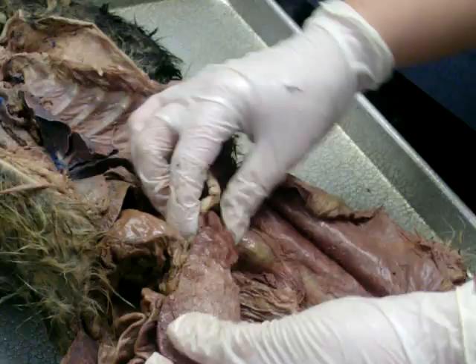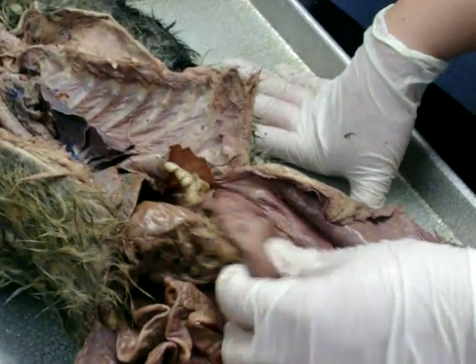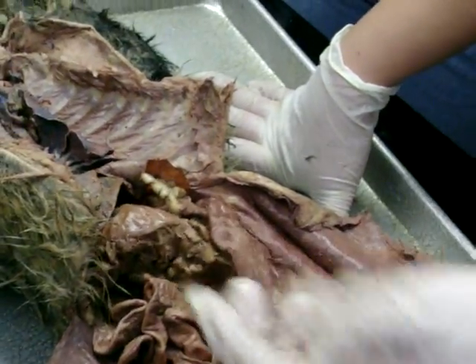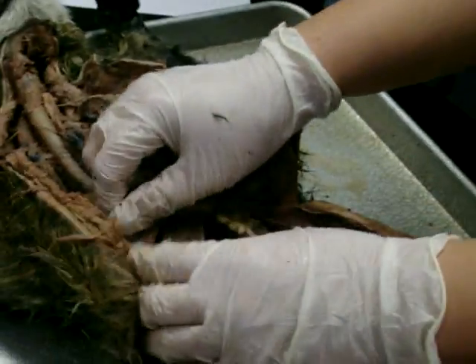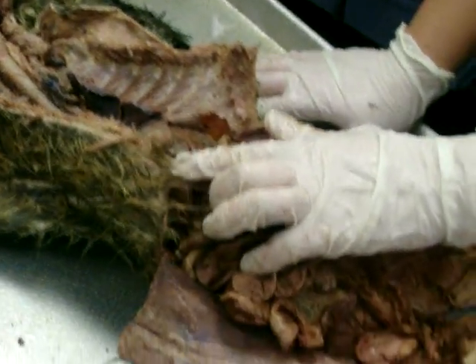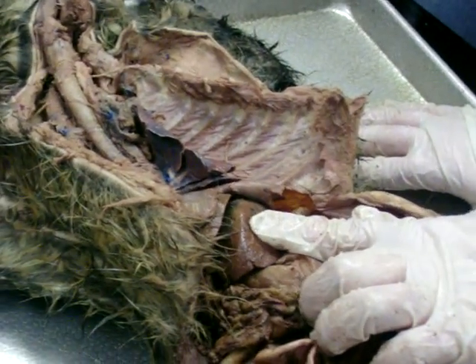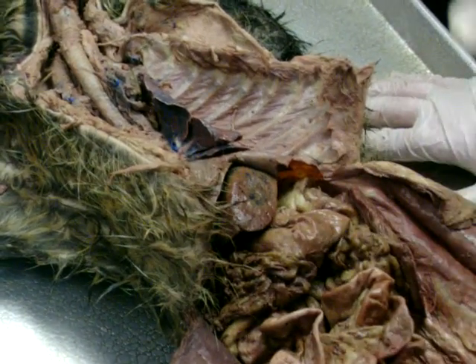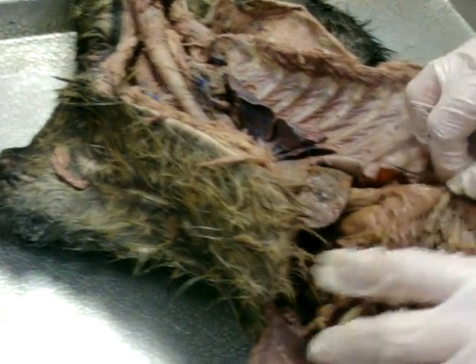Here's the spleen. It's usually located on the left side of the cat. And I always remember it because it looks like, and it feels kind of like a tongue. Yeah, that's how I remember it. And then just below the diaphragm, and people in 221, I would label this, and they would call it the stomach. Because people take for granted that they're going to know the stomach when they see it. Make sure you know the difference between the liver and the stomach. Okay? Just don't take it for granted, you know?